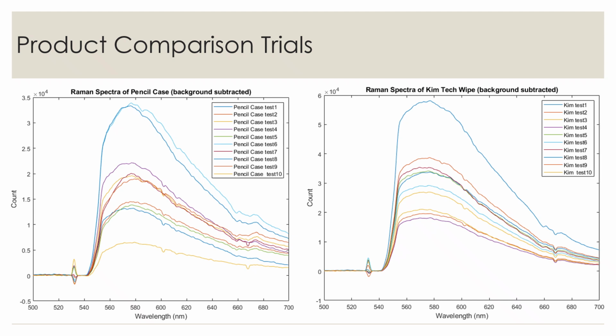The results remain very consistent within the 10 trials for each item. Though the spectra of the pencil case and the Kimtech wipes appear similar in shape, there are clear differences within the dips and peaks of each spectra that separate them, and these differences are clearly reproducible.